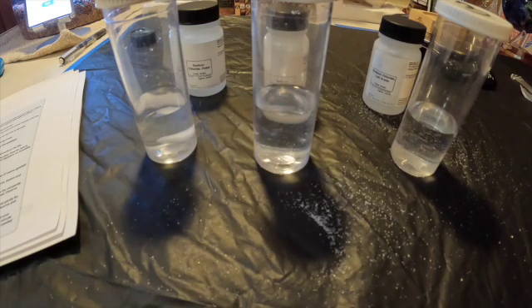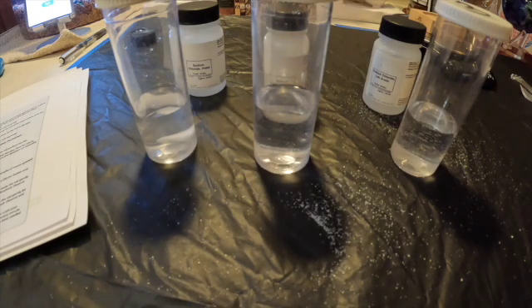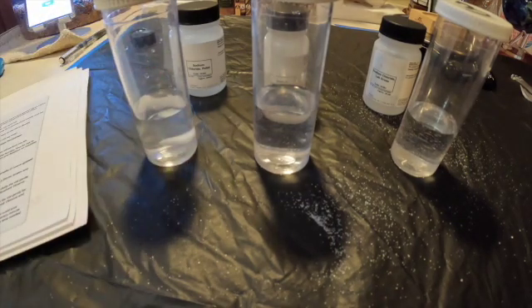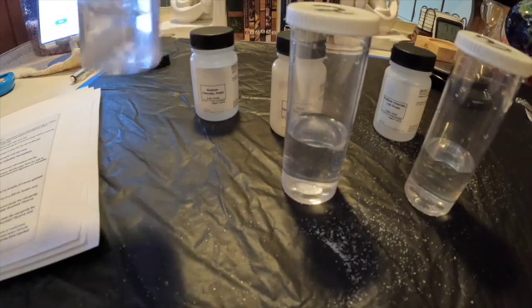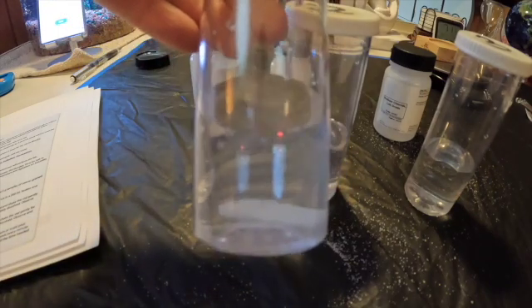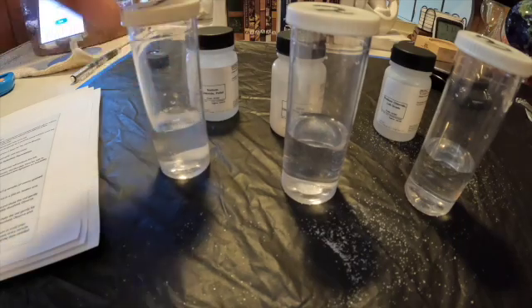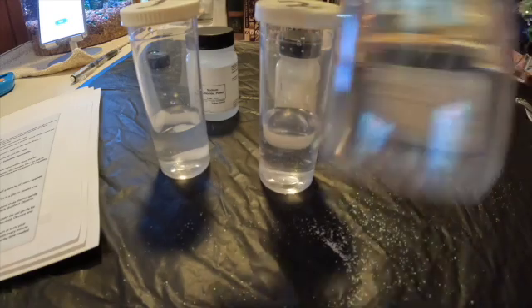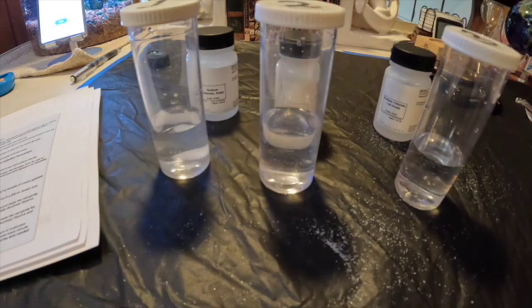We are now at a total of six minutes of agitation and these are our final observations. Vial number one with the pellet is not fully dissolved. Vial number two with the coarse grain is almost dissolved — you can still see a little bit. And vial number three with the fine grain has nearly fully, if not fully, dissolved — you can see how clear it is. We will now be moving on to part three.